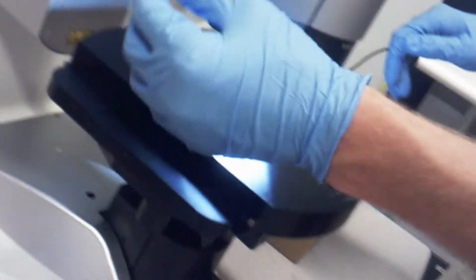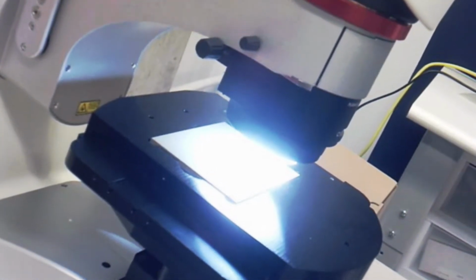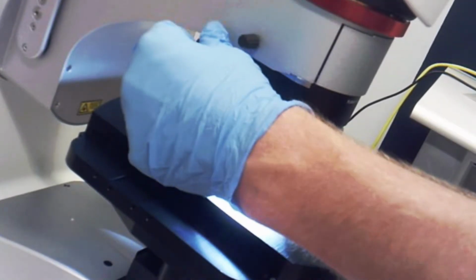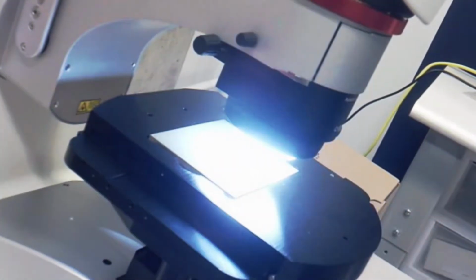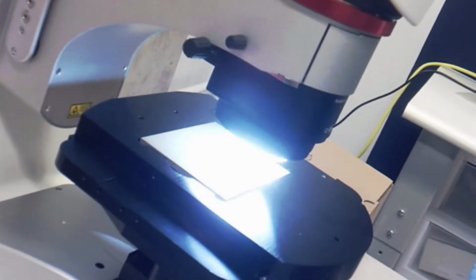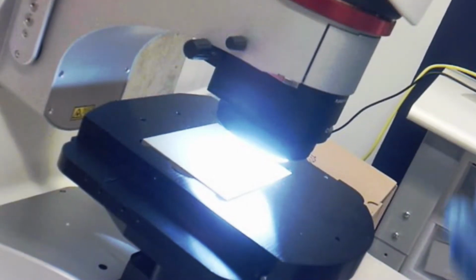There's the one dial here which is adjusting the coaxial light or CXI light and its intensity, and you can just rotate that back and forth. And what that'll do is if you have the CXI light enabled, it will decrease its intensity by putting a shutter over it. And this can be useful for a variety of samples, especially when they're highly reflective.